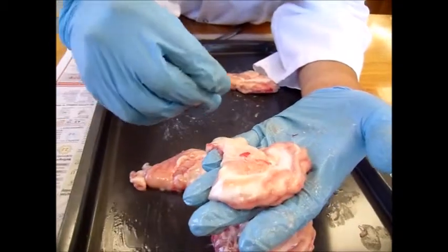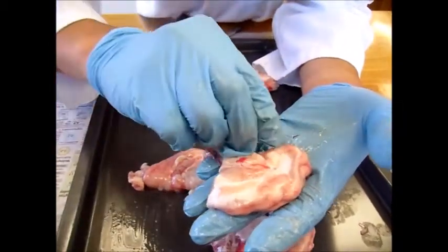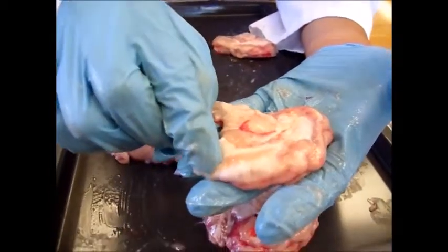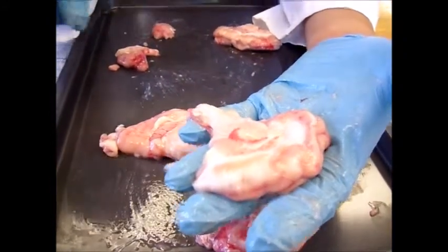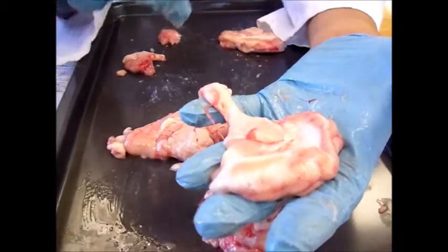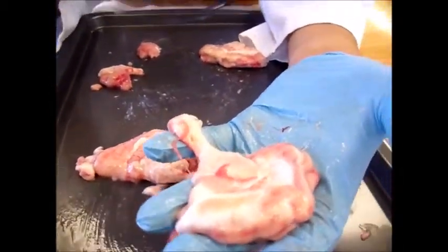Also part of the forebrain is the thalamus and hypothalamus. So the thalamus passes most sensory information onto the cerebral cortex after helping to prioritize it. In contrast, the hypothalamus is the control center for appetites, defensive and reproductive behaviors, and also sleep-wakefulness.